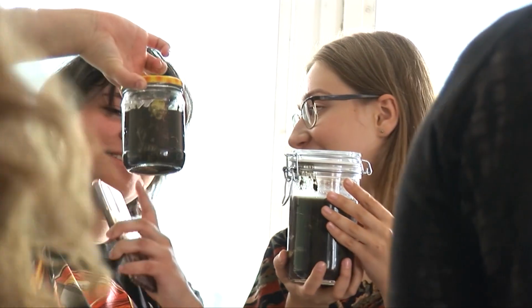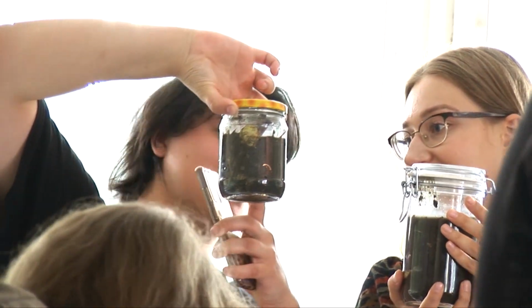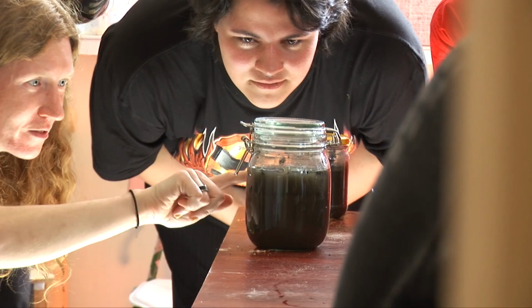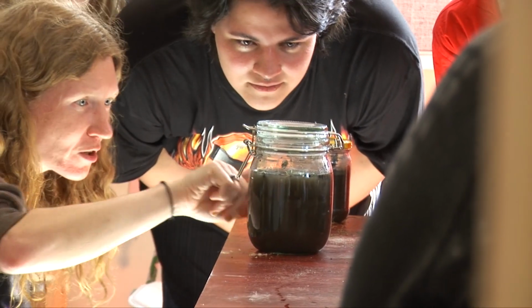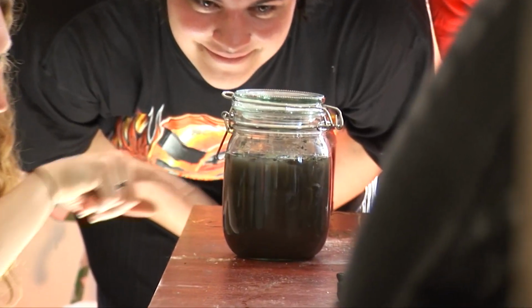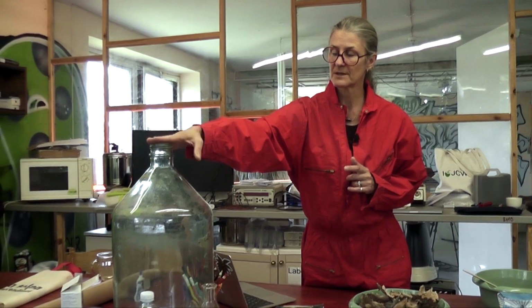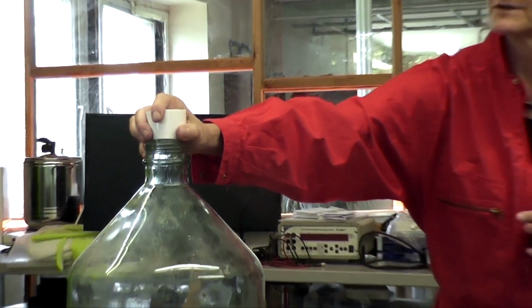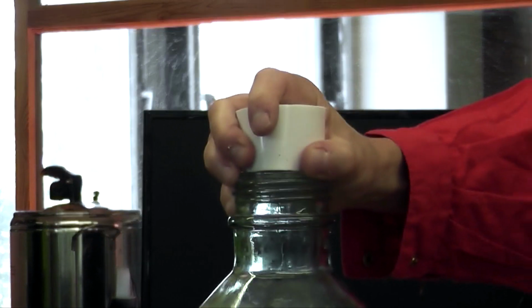And then step 4 is to make that into a closed system. So for the first couple of weeks, you do want to put a lid on your Winogradsky column, but you do want to be able to let it burp a little bit. The bacteria, as they move around and ferment and sort themselves out, will be emitting various gases. It can be really smelly. It can be unpleasant. It can smell like drains. So you want to be able to burp it, just lift up the lid and let a little bit out. But after a couple of weeks, it will settle, and then you want to seal it. You want to close it off so it becomes a closed system.